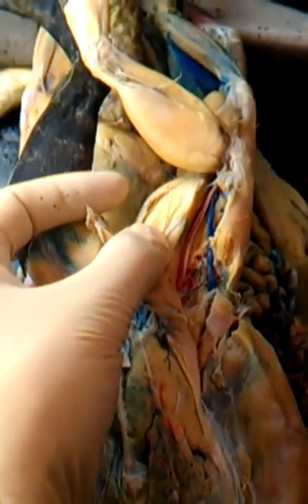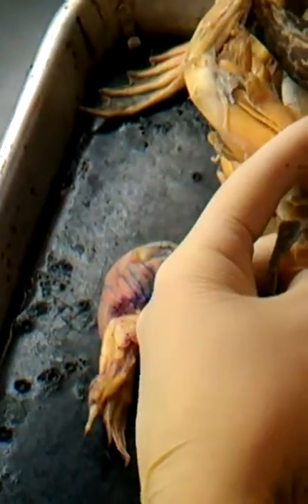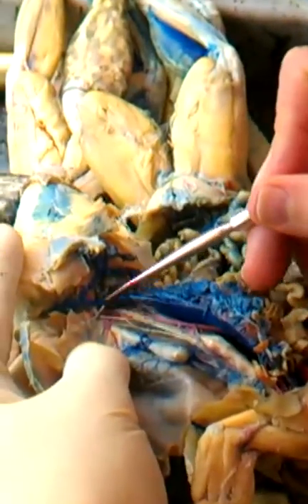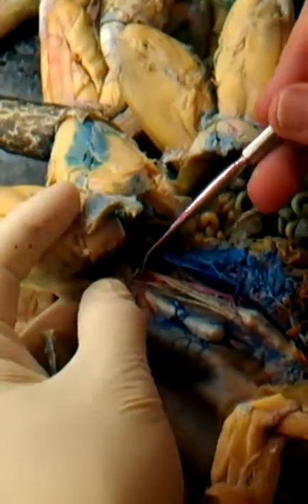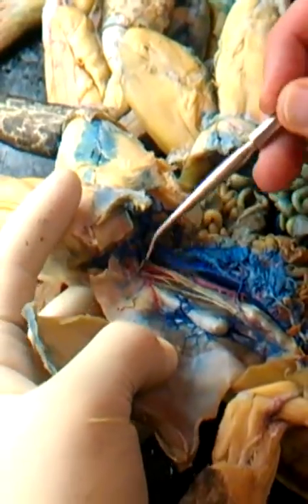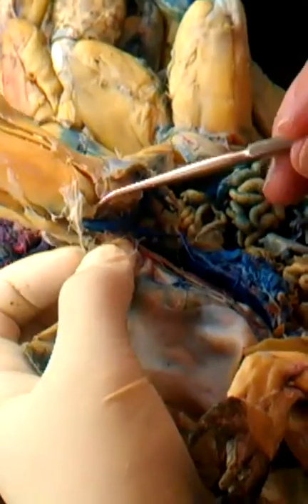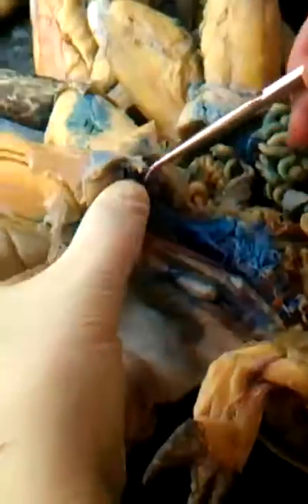Now, there are two small branches coming off the common iliac, which I'm going to flip back over. This may not be that easy to see in here, but you can see two branches, let me help you out here. One right here, and then one down below it right in here. The top one is the epigastric artery going to some abdominal wall muscles. This is epigastric. The bottom one is the femoral artery right here. You can often see this one reddish right in this area here, but it's gotten a bit torn. But that is the femoral artery. But the main line is sciatic.